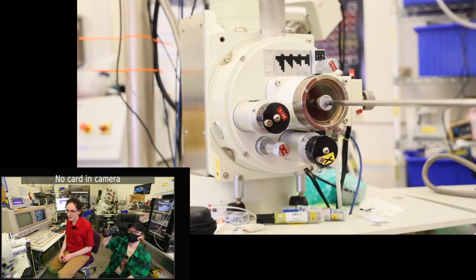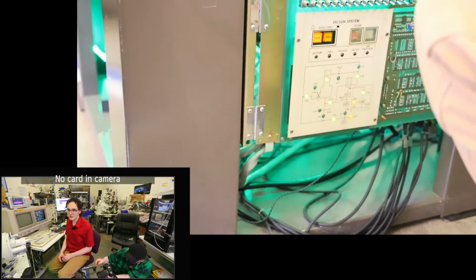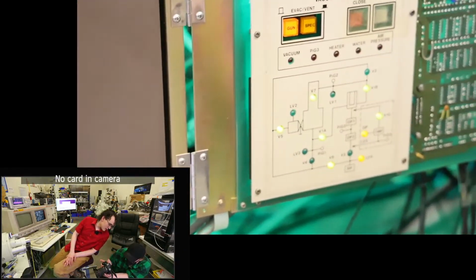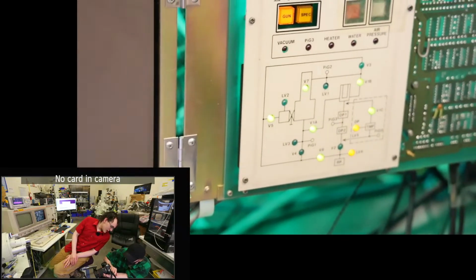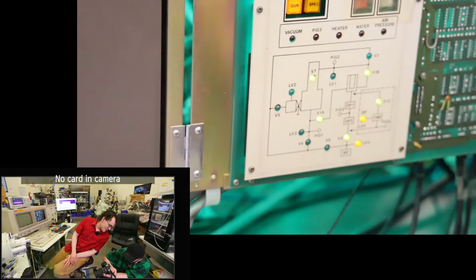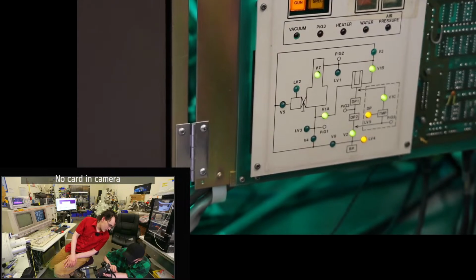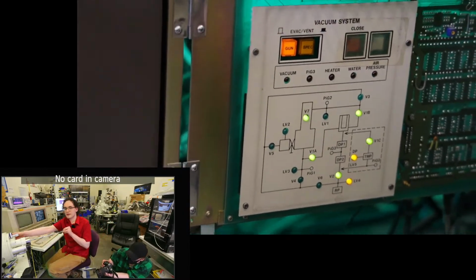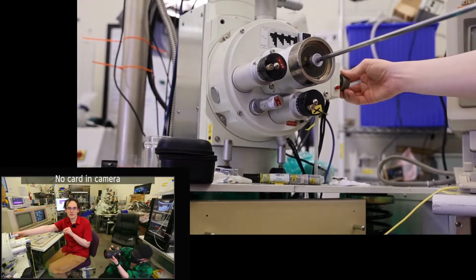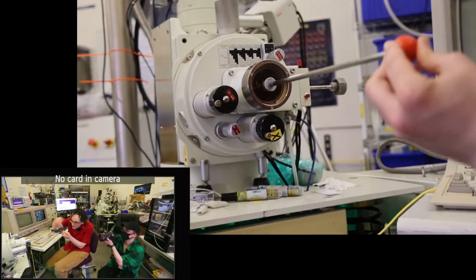So we're just waiting for our load lock cycle. This will wrap up in a second. The exposure set high, but yeah. That one? Yeah. Neutral's in the middle. Yeah, and you can click the back arrow to get out of it. Cool, so that's our pump cycle. So now I can open up our gate valve up here. So we'll roll that towards us, pull that, and now we can check out in the chamber.